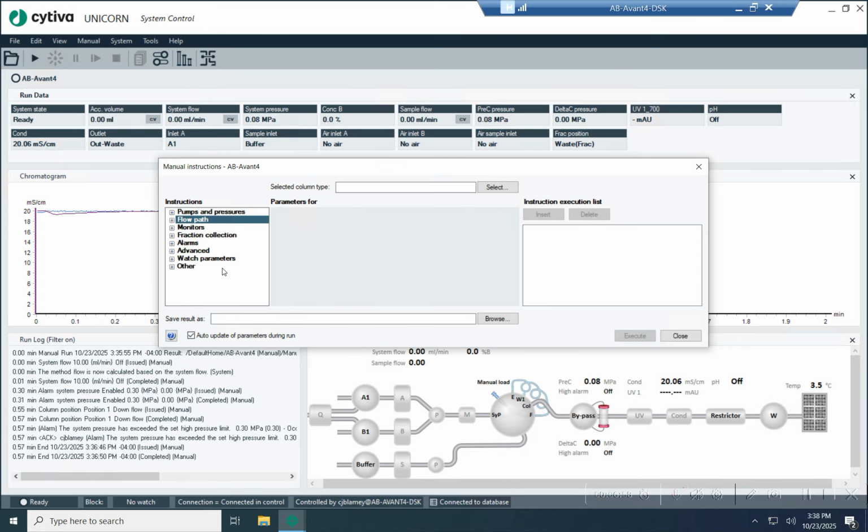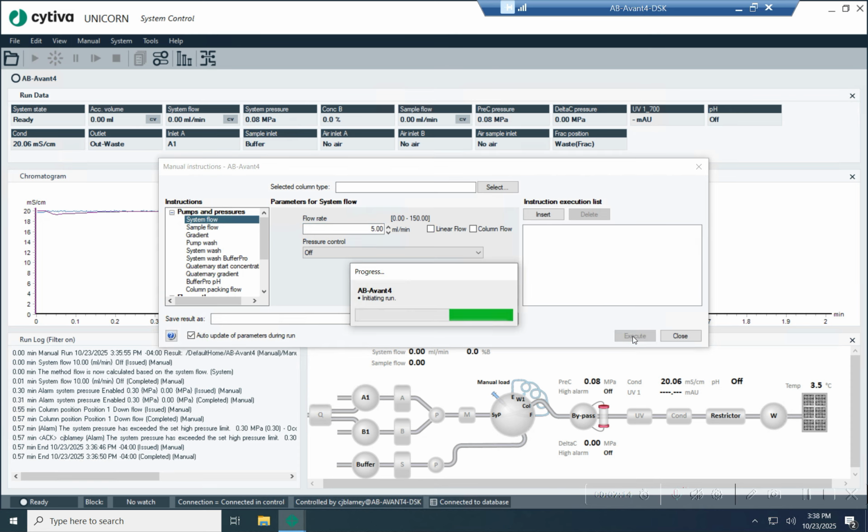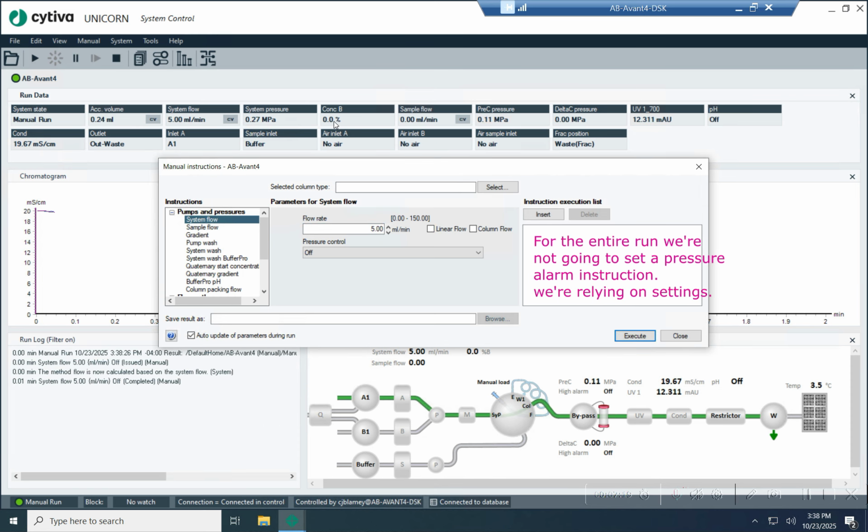So let's trip it now. So I'm going to turn on the flow rate. And I don't know if you know this, but when you turn the system on, there's like a wave of pressure that goes through there because you're turning on the pumps right away. So I'm going to have to work the flow rate up. I'm going to do 5 mils a minute, then I'm going to do 8. There we go. And so now, just like before, we're running at 0.28 at 10 mils a minute.